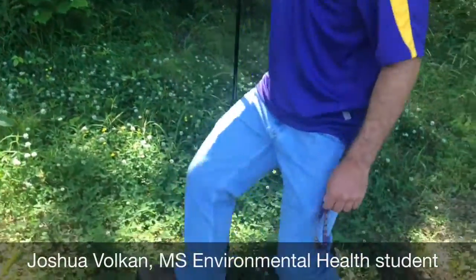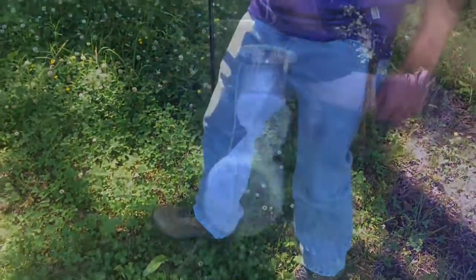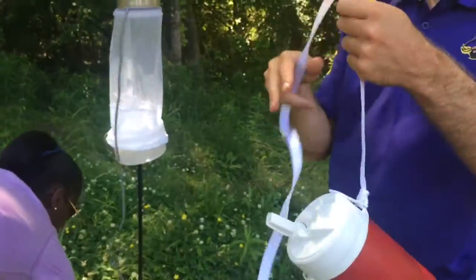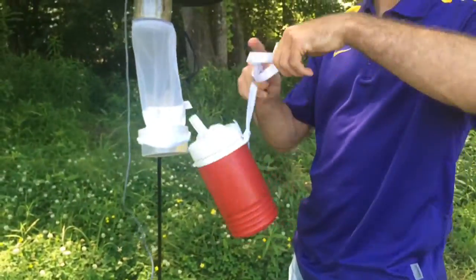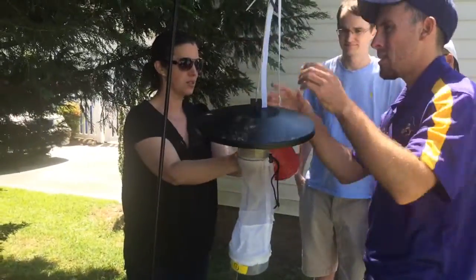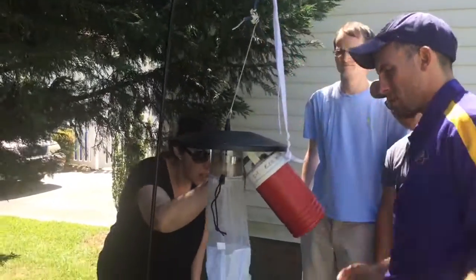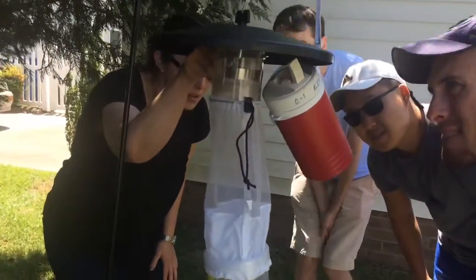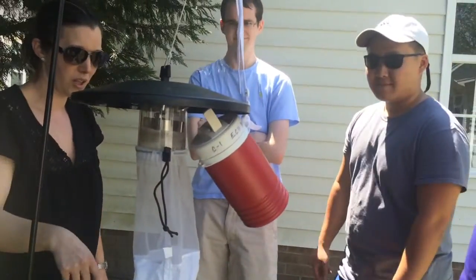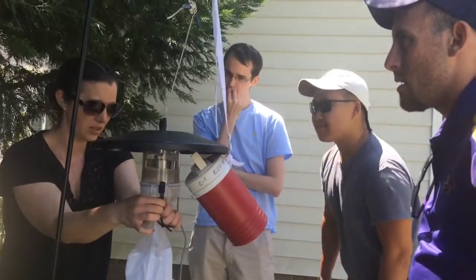Here we're putting in these hooks to hang adult mosquito CDC light traps from. Once plugged in, we bait the entire trap with dry ice, which emits CO2 and attracts mosquitoes. The mosquitoes are attracted to the CO2 and then sucked in by a fan that blows them down into a netting all night. In the morning you come back and take the collection off.